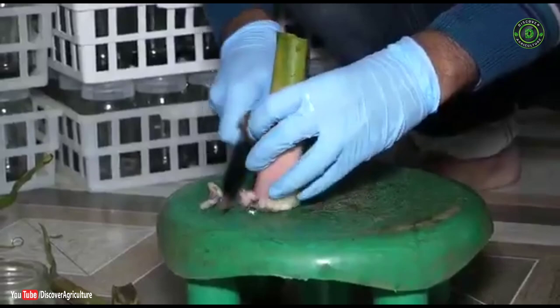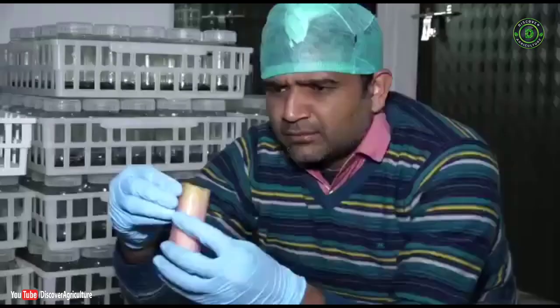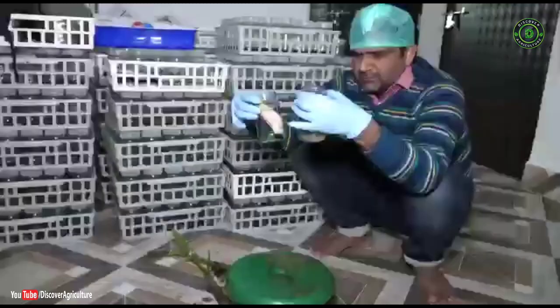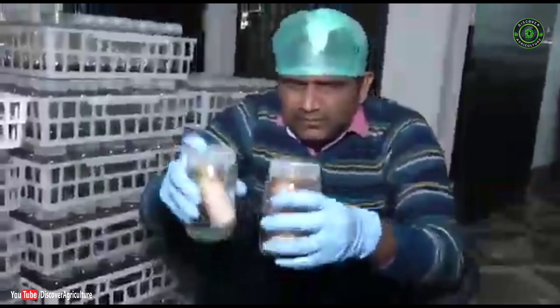The suckers are cut to expose the shoot tip of 10 cm cube and cut further to about 3 cm diameter and 5 cm length. The explant should be carefully cut to avoid injury to the growing meristem. The shoot tips are then washed in tap water.